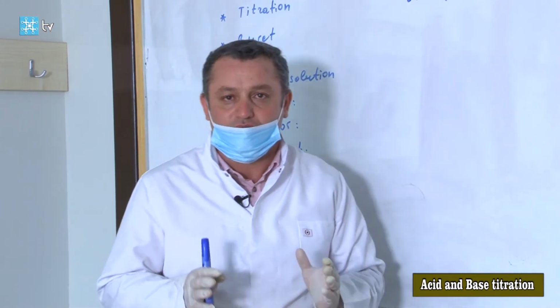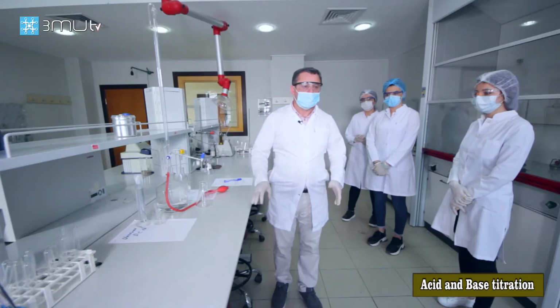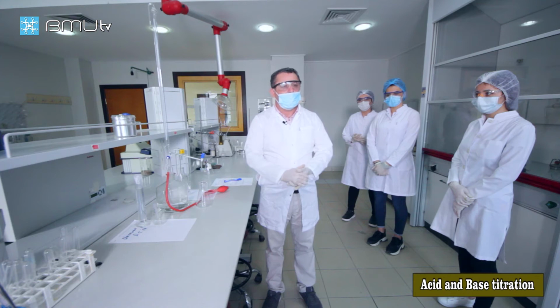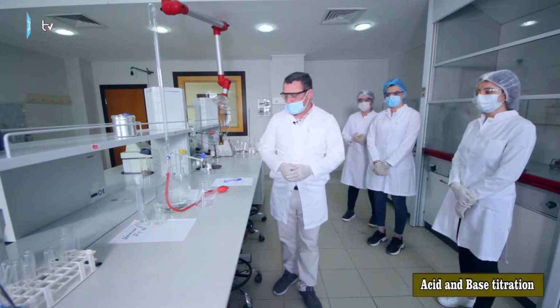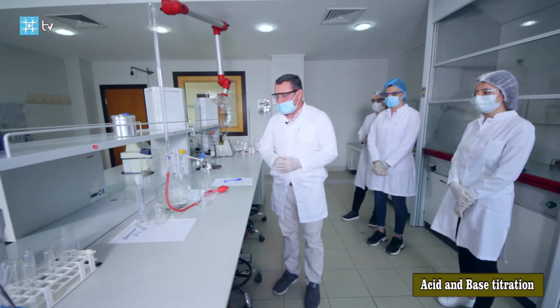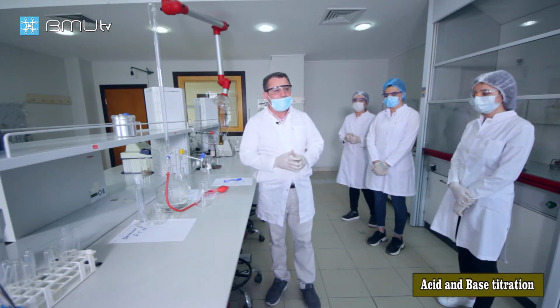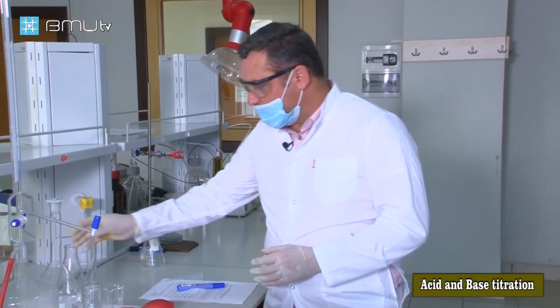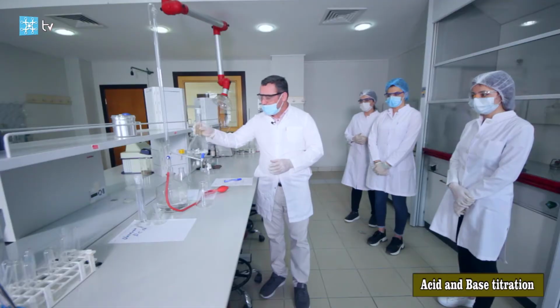Now let's do the procedure part of the experiment. A few minutes ago, we gave the brief information, the theoretical part of the titration process. Let's do the experiment. For this experiment, we need several compounds and equipment. For example, we need a standard solution.